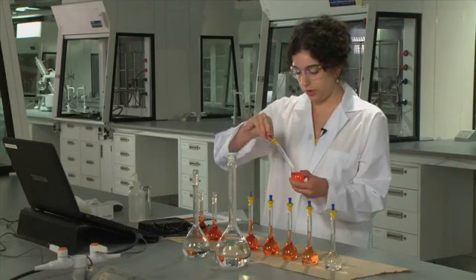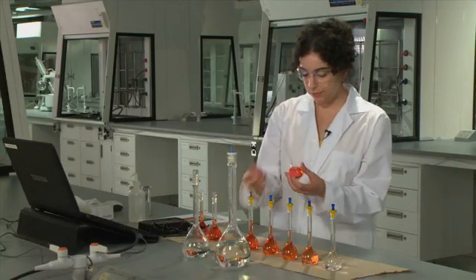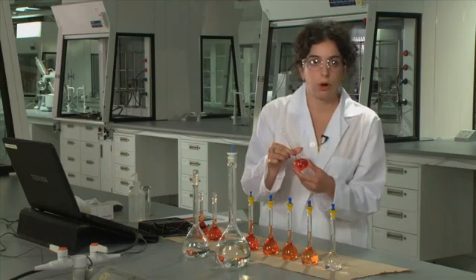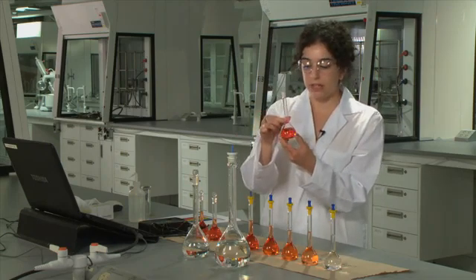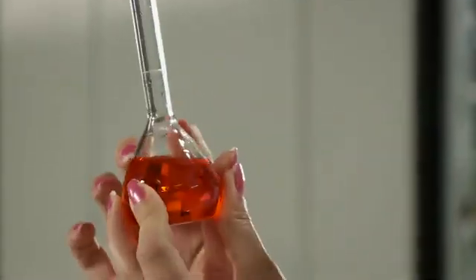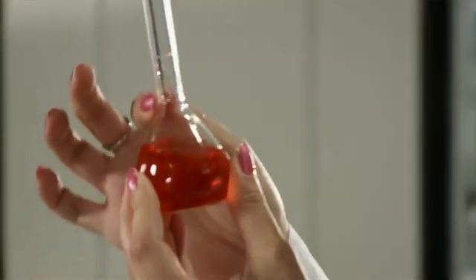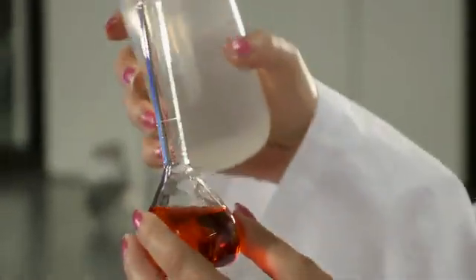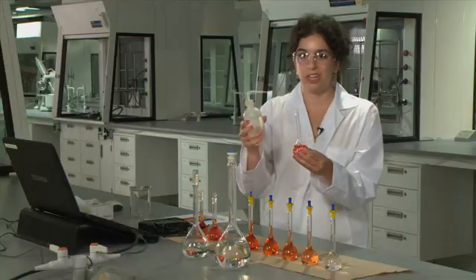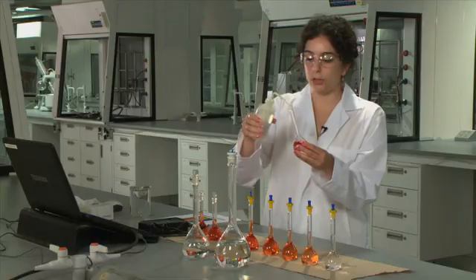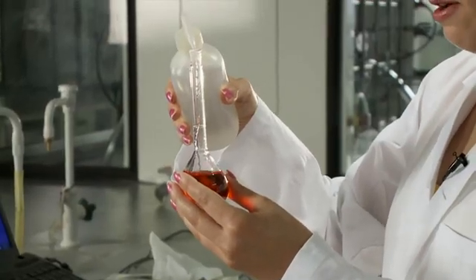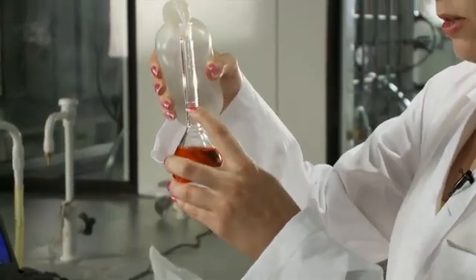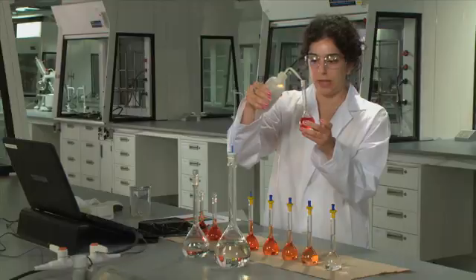So to show you an example here, what you can do to sort of speed up your preparation is fill up the flask with distilled water around to where the neck starts, and then you'll add distilled water a little bit more slowly with your wash bottle, and fill it up to where the line is on your flask.